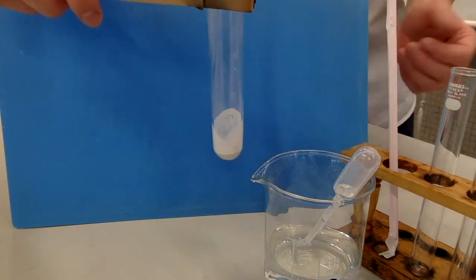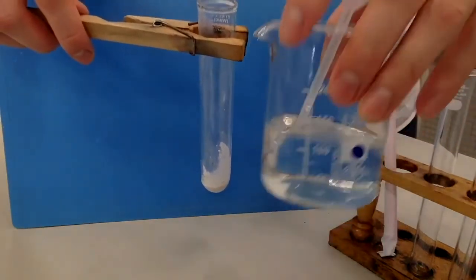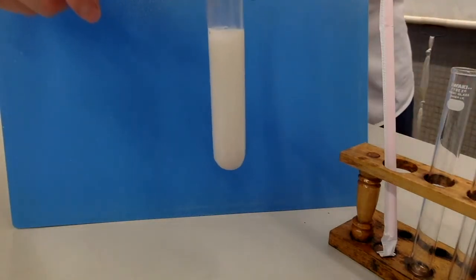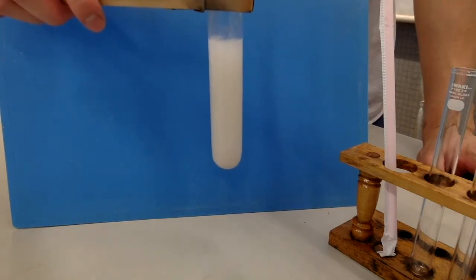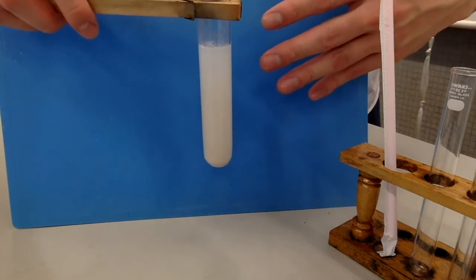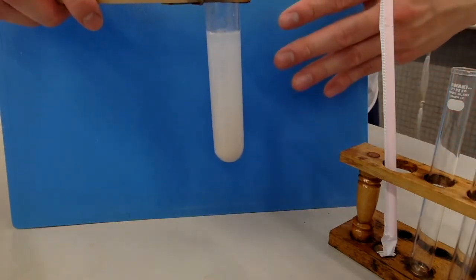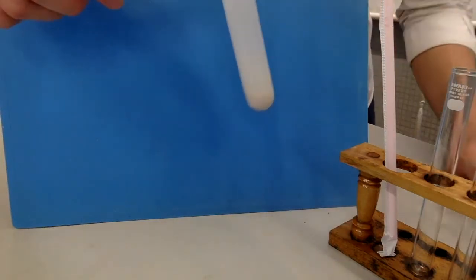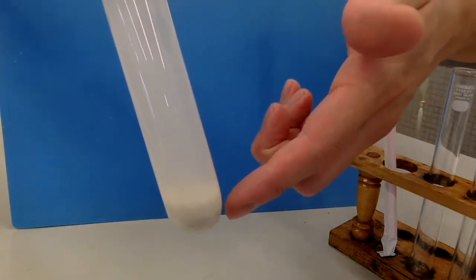Now we add more water to dissolve as much calcium hydroxide as possible to make lime water. You see a very milky solution. Lime water is supposed to be colorless, but right now we still have some unreacted calcium carbonate, which is insoluble in water — that's the milkiness. If you look closely, you can already see a lot of white precipitate settling at the bottom of the boiling tube.